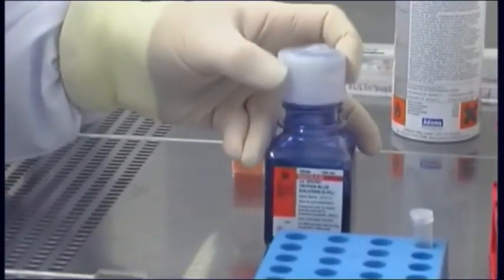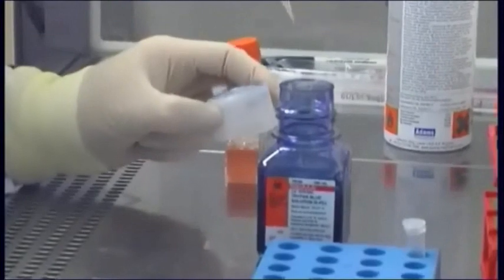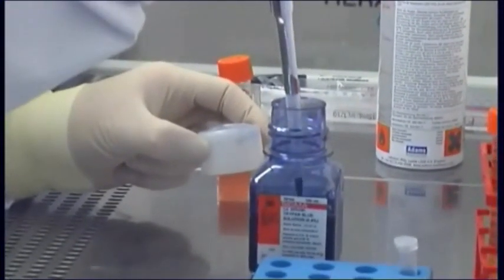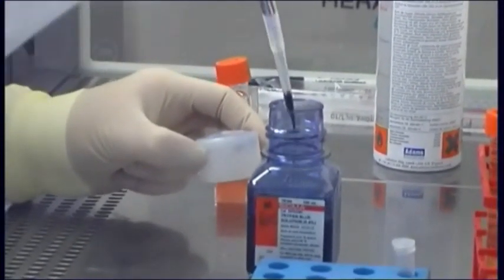Then add an equal volume of trypan blue. Mix by gentle pipetting.